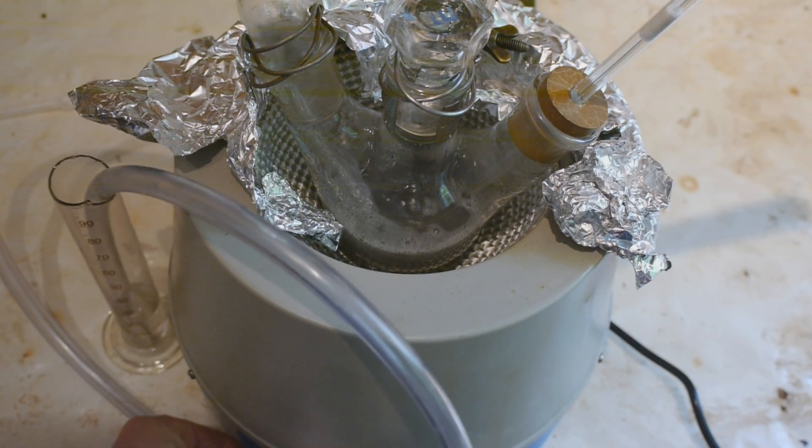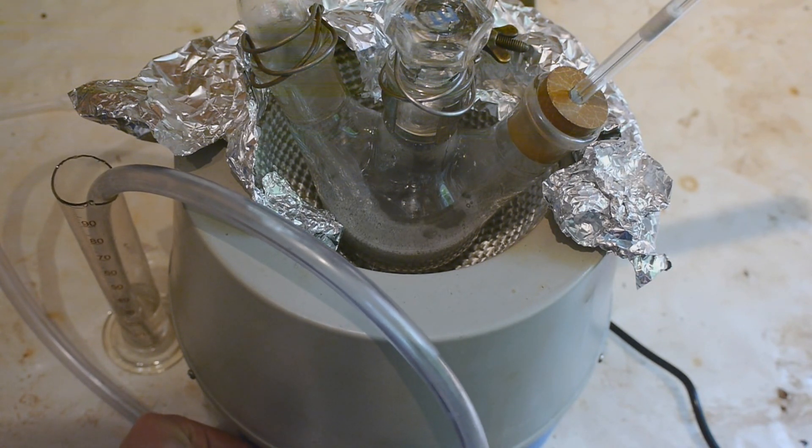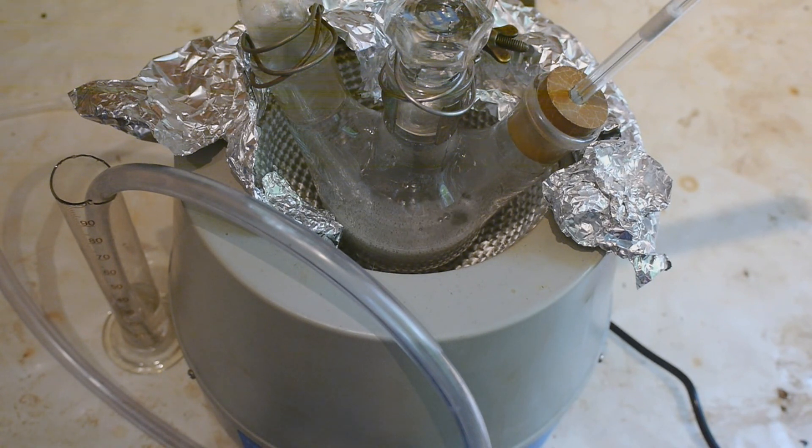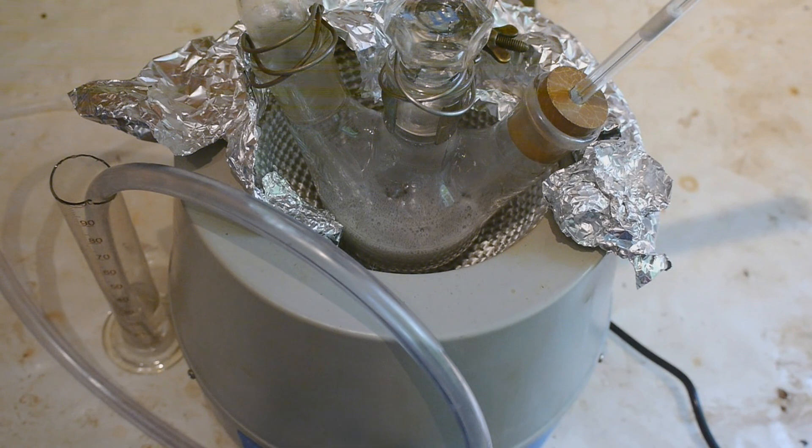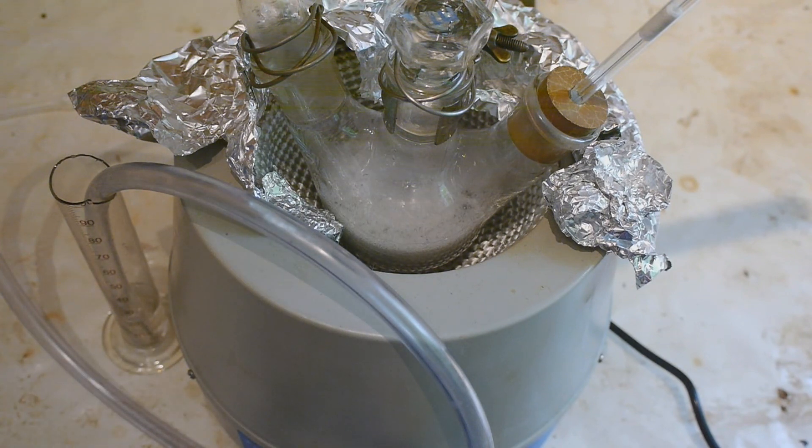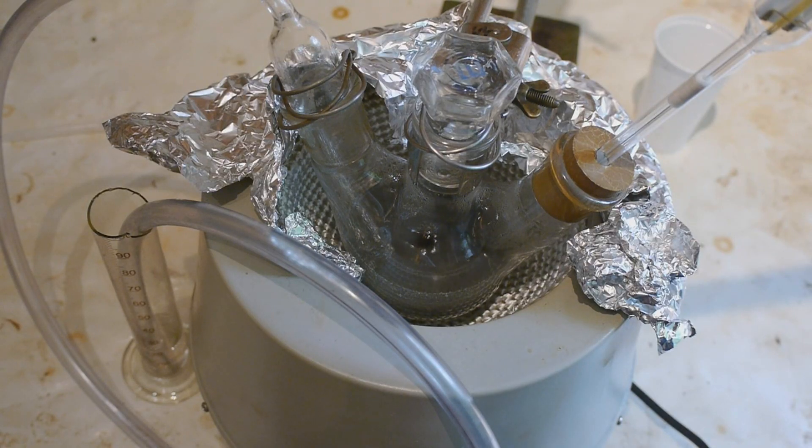We have now reached an inside temperature of 120 degrees Celsius and as you can see the mixture started to bubble a lot. It's a good sign, so it's doing something at least. Probably the sodium is first of all reacting with the leftover water and the sodium hydroxide to produce more sodium hydroxide and hydrogen gas. I've turned off the heat now but the temperature keeps rising. So that's not a big surprise because the reaction is exothermic. I'm just a little afraid it might bubble over.